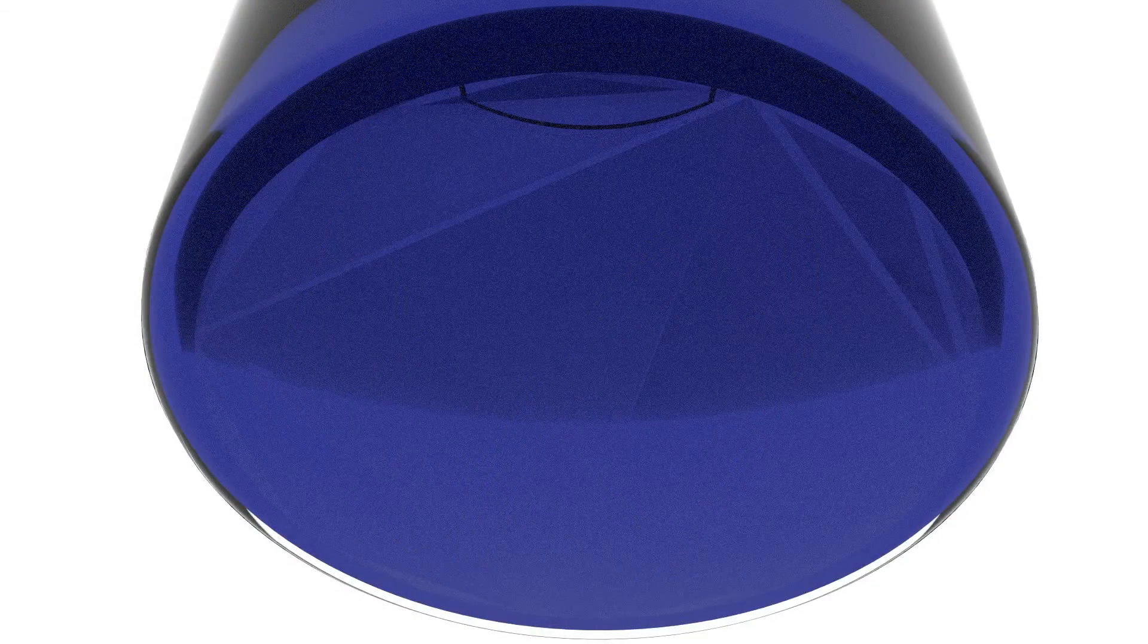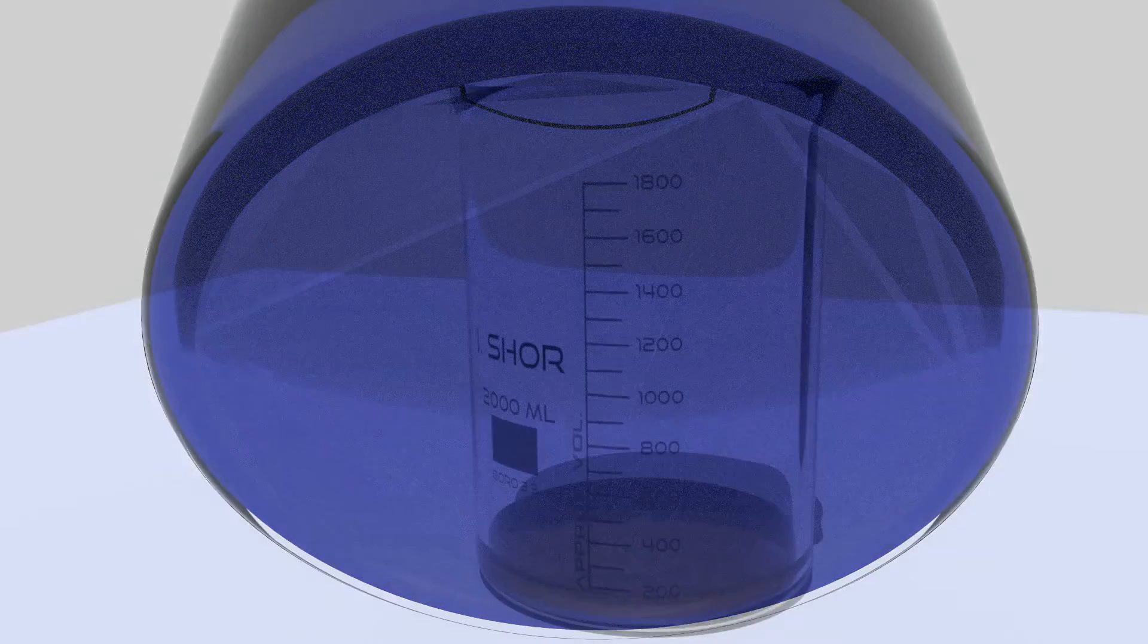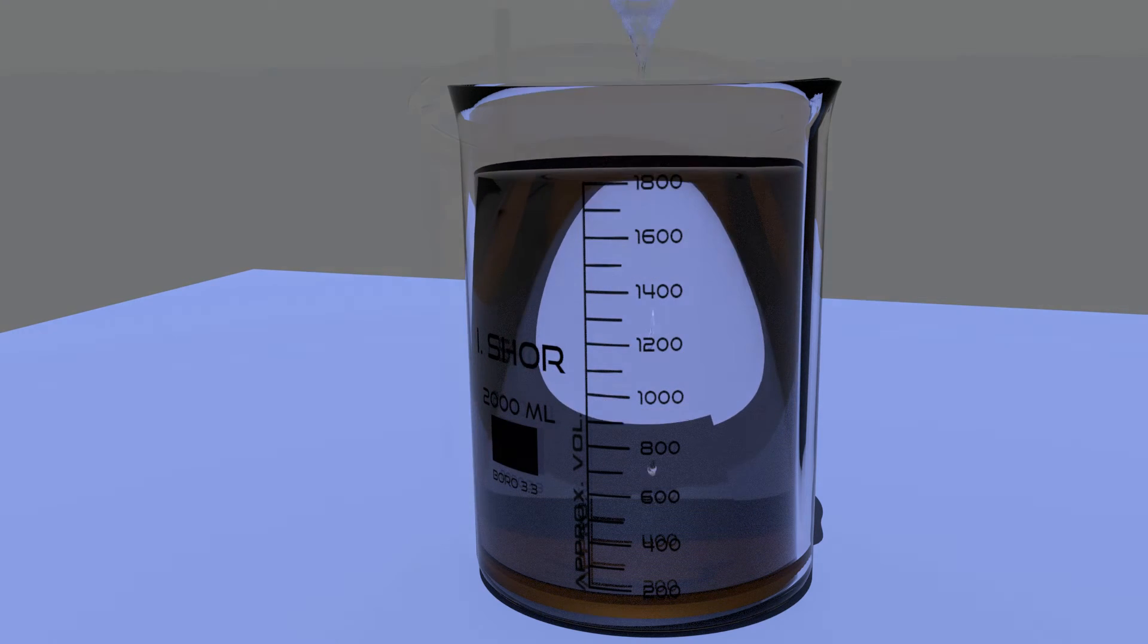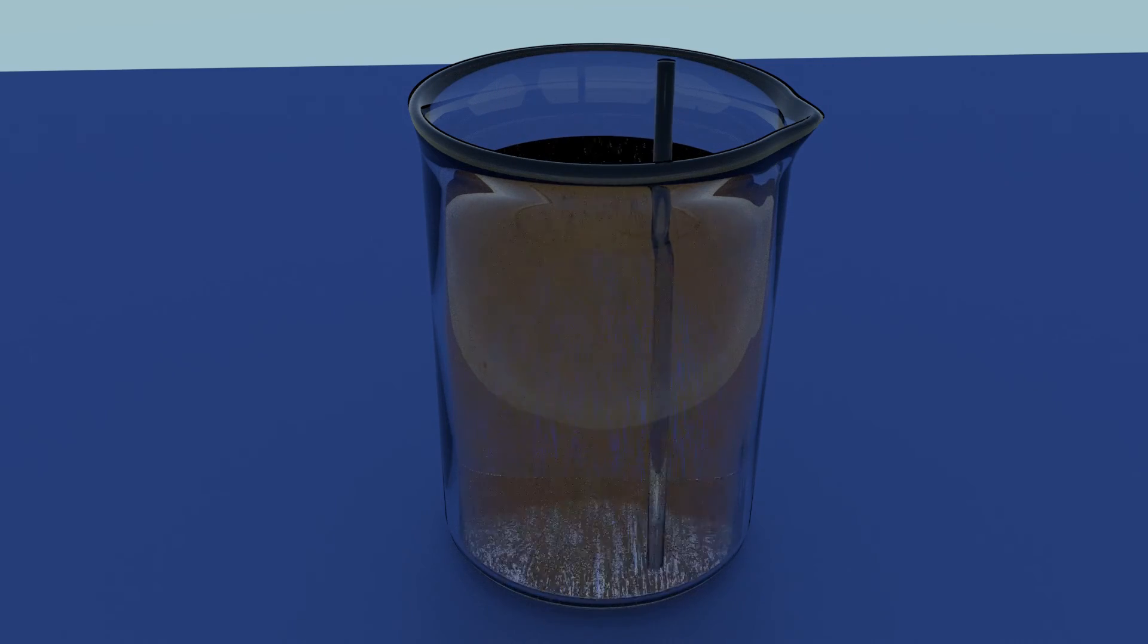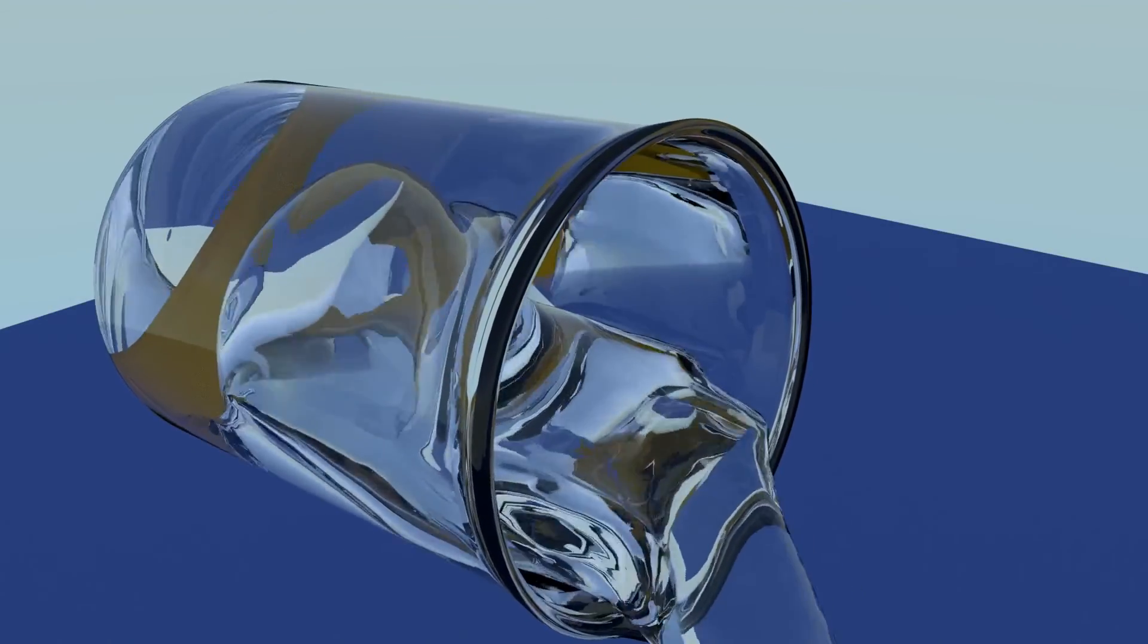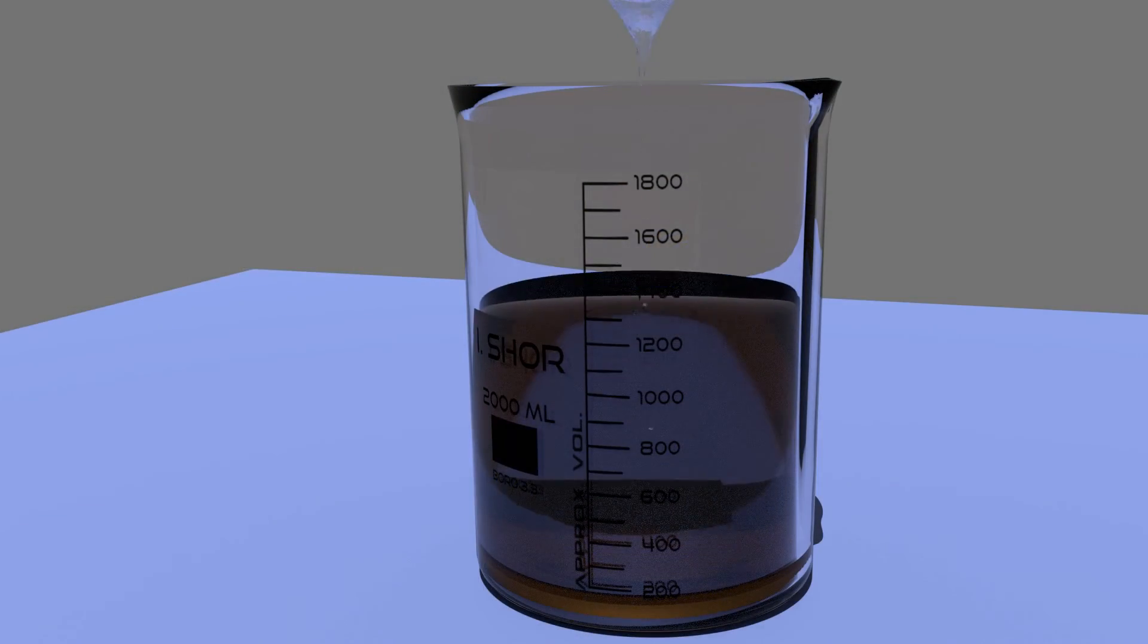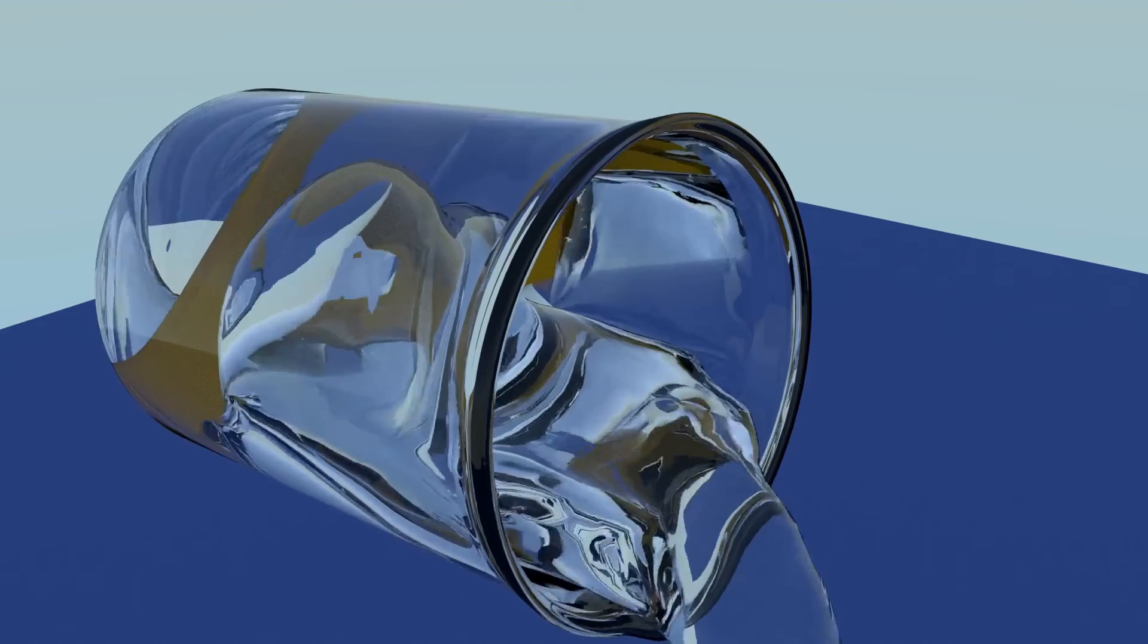Save the solution so that you can check it later for particles. Fill the beaker with water. Tap water is fine. If you would like, you can give the water a stir. Then give the gold particles a chance to settle. Decant the water, saving it to check later for gold particles. We'll want to rinse one more time with water before checking to make certain that the gold has been thoroughly rinsed.